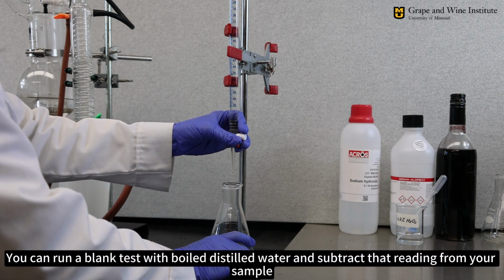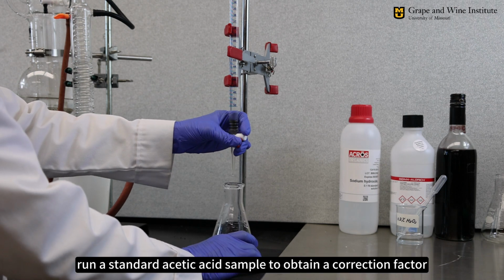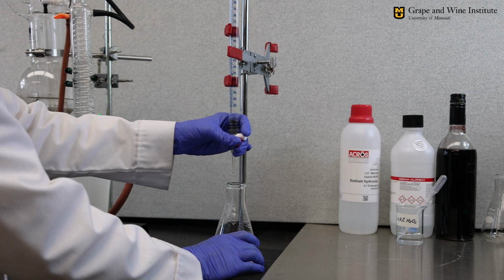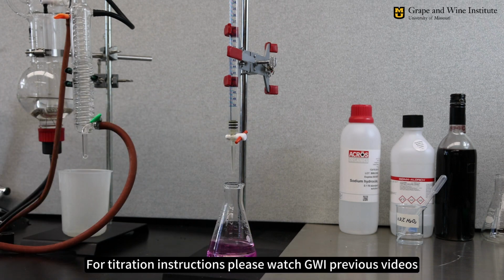You can run a blank test with boiled distilled water and subtract that reading from your sample. Also run a standard acetic acid to obtain a correction factor. For titration instructions, please watch previous GWI videos.